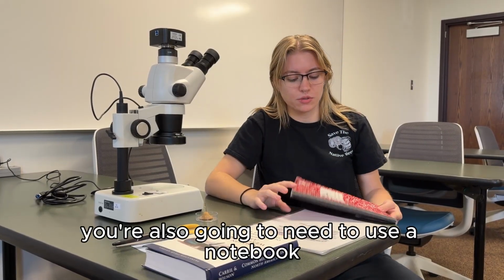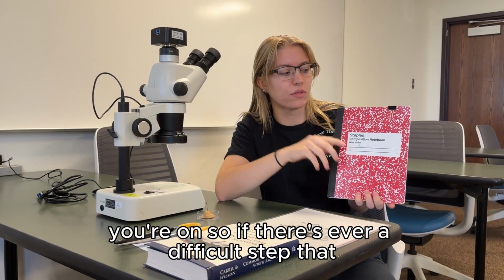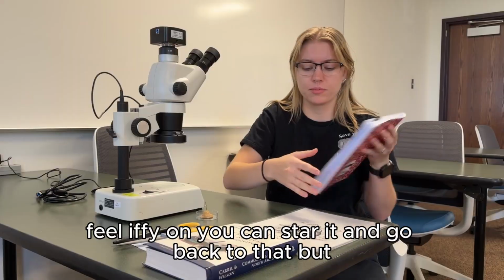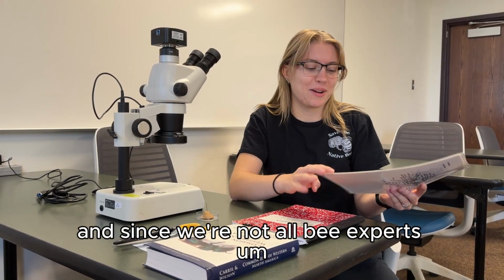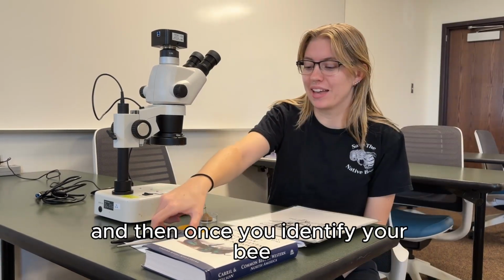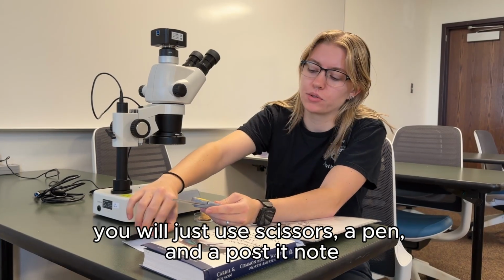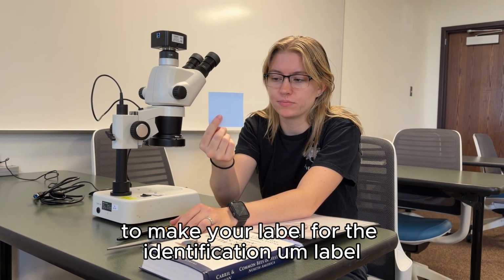You're also going to need to use a notebook, and this is going to help you keep track of the steps you're on. So if there's ever a difficult step that you might feel iffy on, you can go back to that, but we'll talk more about that. And since we're not all bee experts, you're also going to need diagrams for these very specific parts. And then once you identify your bee, you will just use scissors, a pen, and a post-it note to make your identification label.